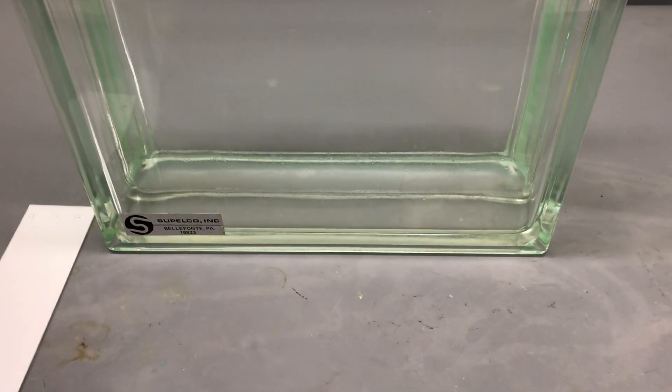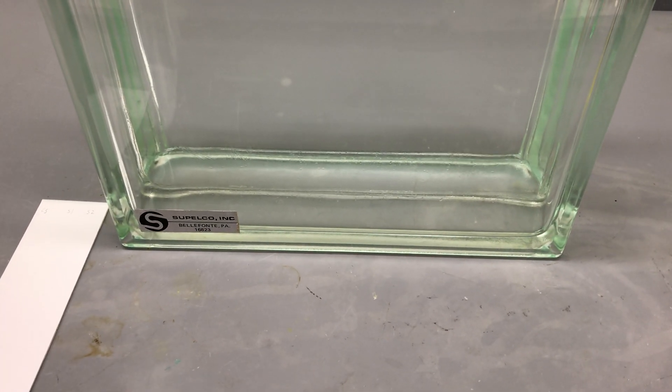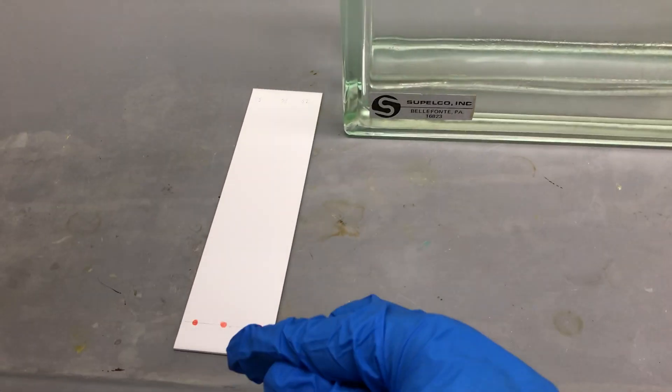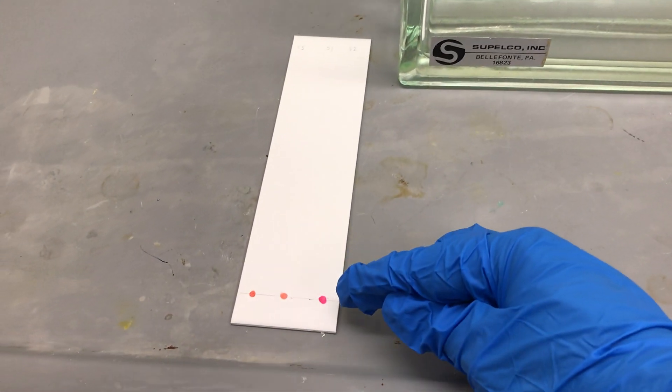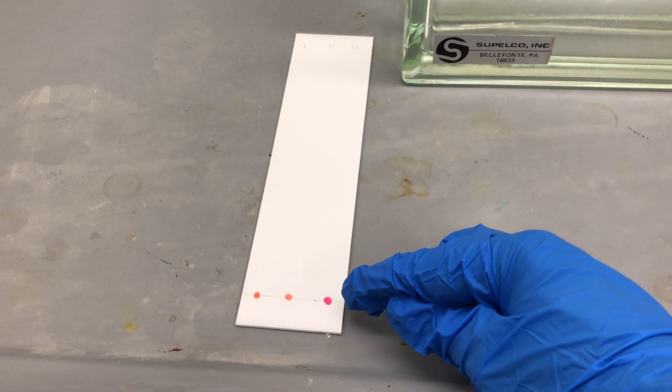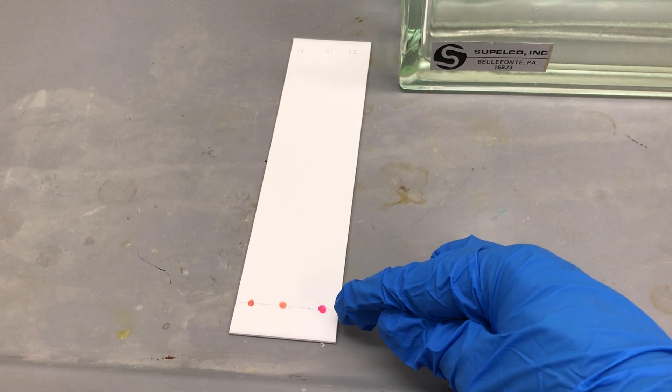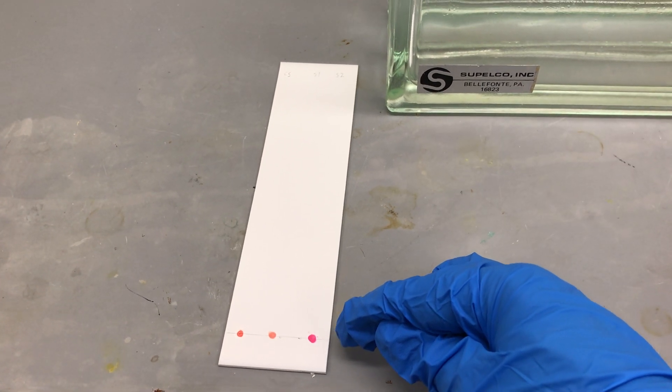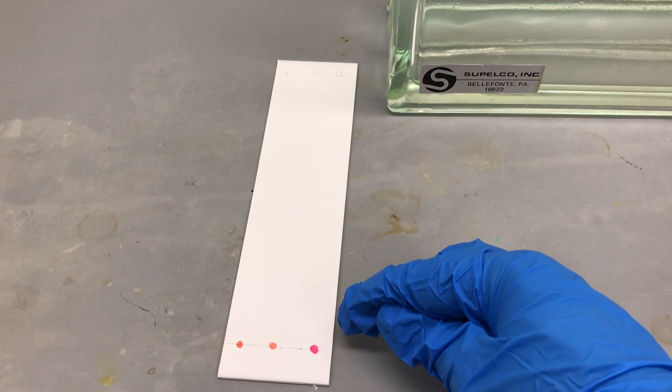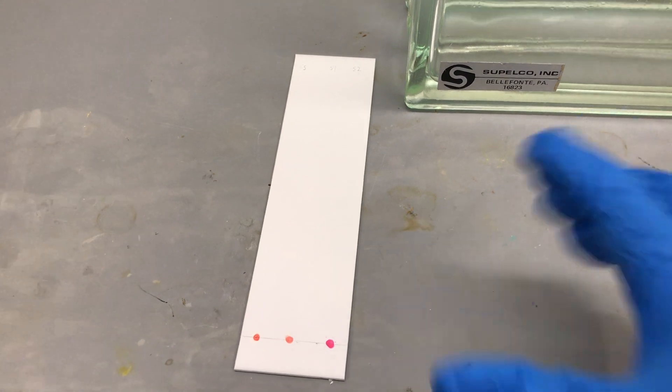Now this is a different mixture of solvents that will essentially start moving up our plate via capillary action, dissolve the organic components of our lipstick dots, our little stains there, at the spotting line.